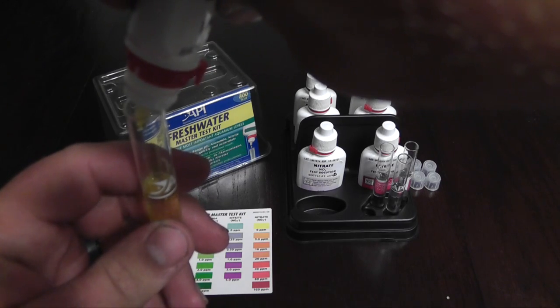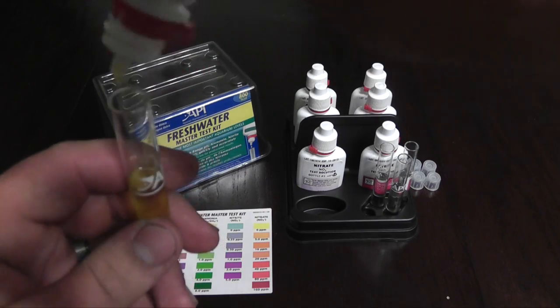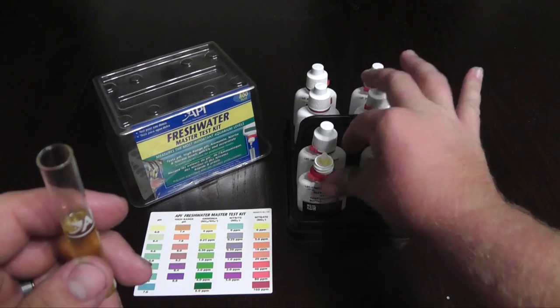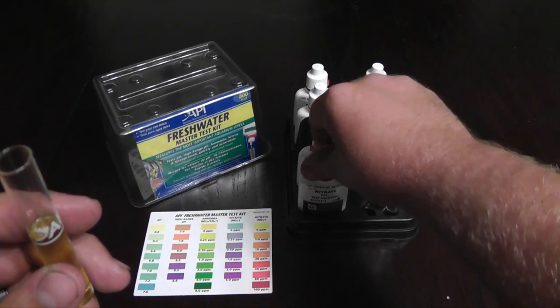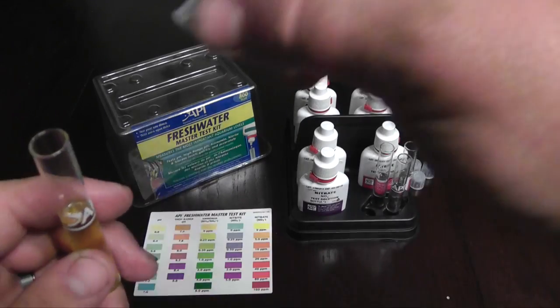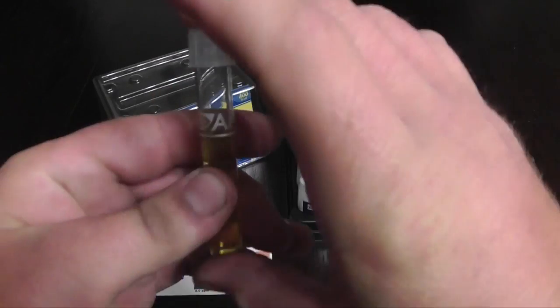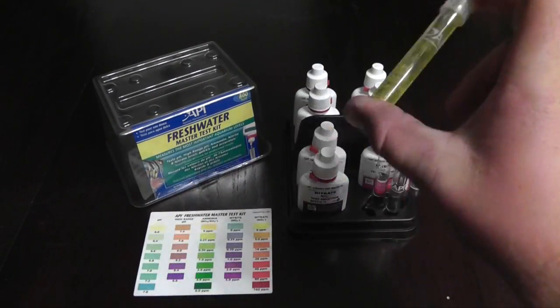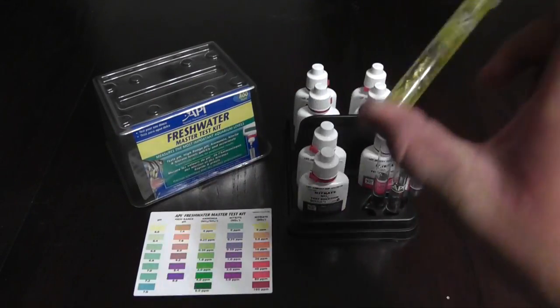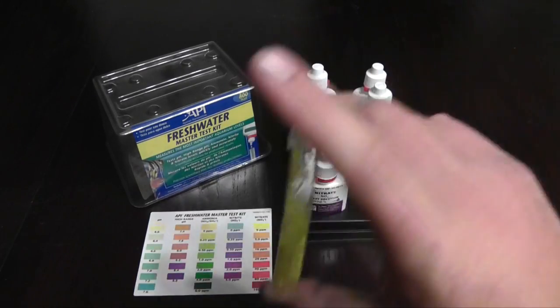So let's start out with this one right here and we'll go. One, two, three... And that's done. And you always want to shake up the solution that you just mixed inside of your water. So take it and shake it up for a good minute or two.